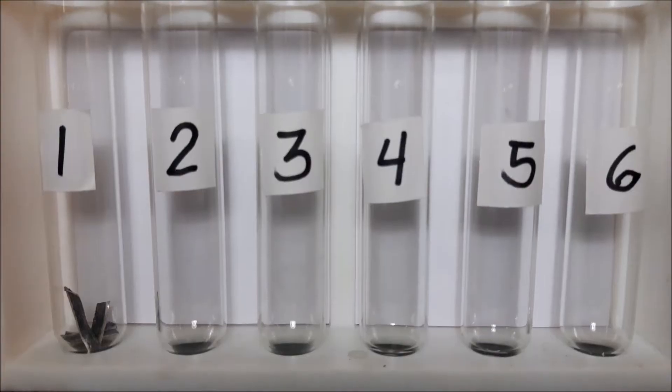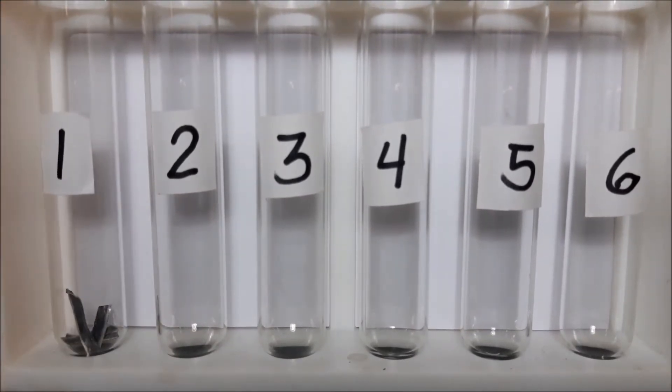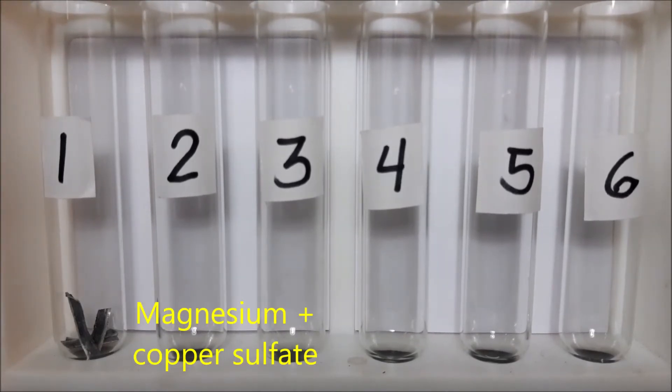So let's begin with the experiment. For test tube number one, I put magnesium and then we will add the copper sulfate. Let's see what will happen.